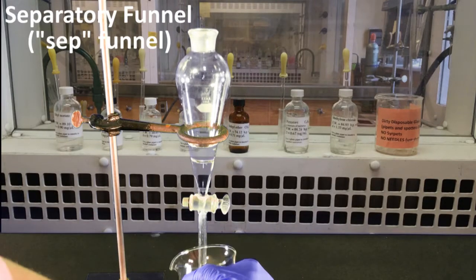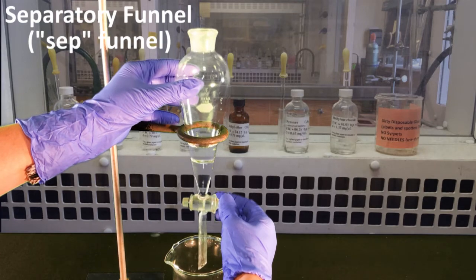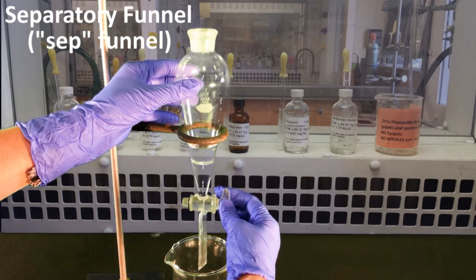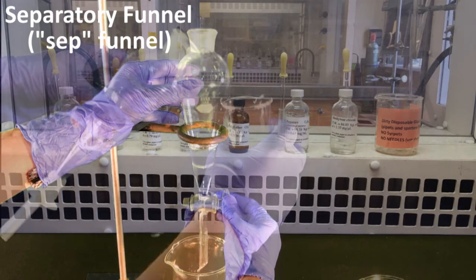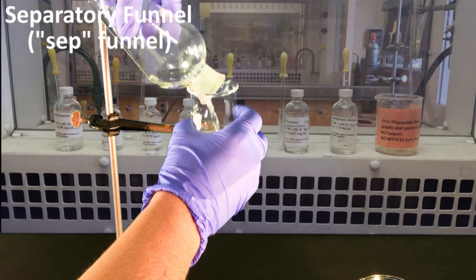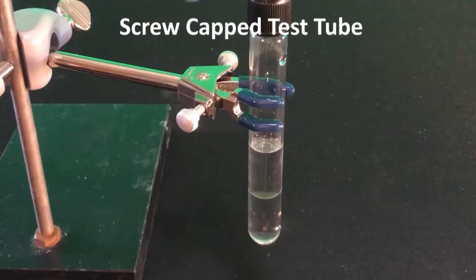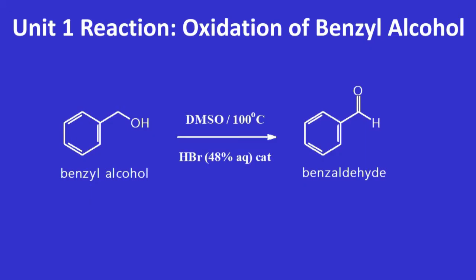The glassware typically used for this separation is a separatory funnel. A separatory funnel, or SEP funnel, is handy since you can drain out the bottom layer and pour off the top layer. But we won't use a separatory funnel since we are working with small volumes. We will use a screw-capped test tube, which will be more efficient when working with small volumes. Let's see how this technique works as we relate it to the workup step for Unit 1.